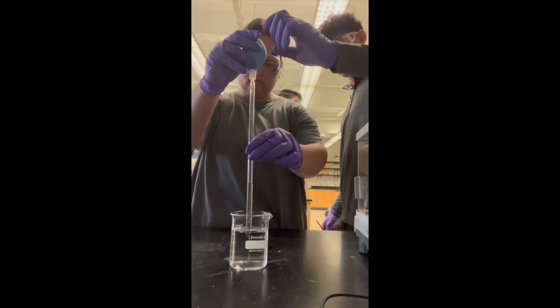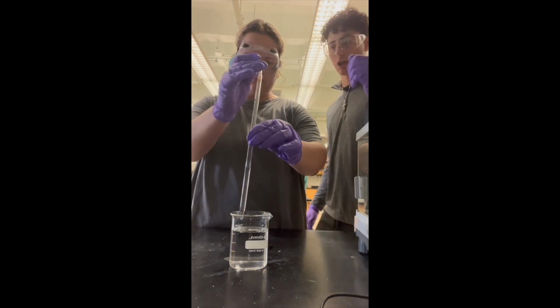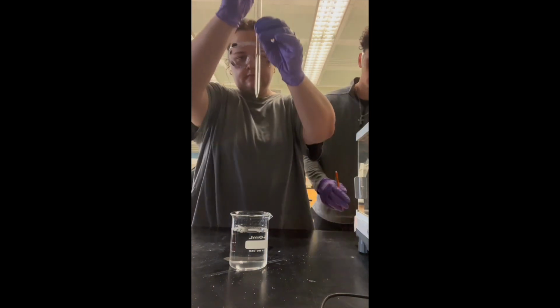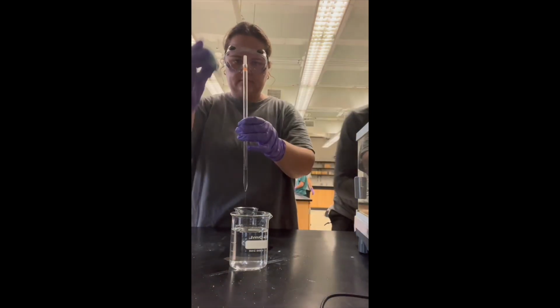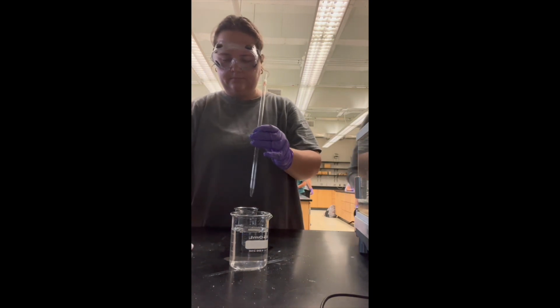Next, we had to record data to establish a relationship between the concentration of sugar in aqueous solutions and the solution's density. We did this by taking the concentration and density of a solution and finding out the density and concentration of the solution after adding water with no sugar concentration.